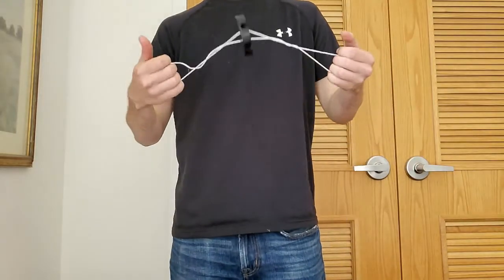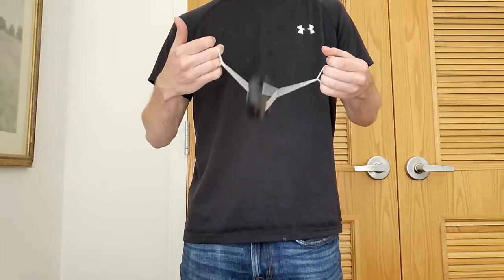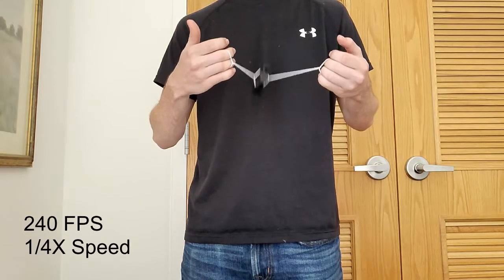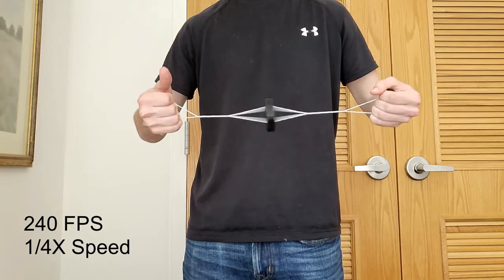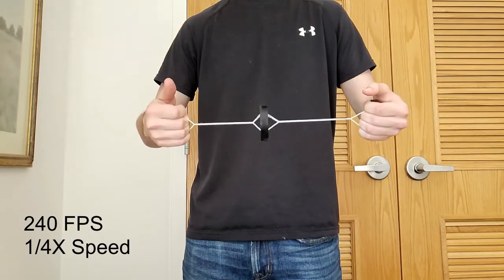Next, I wanted to document actual operation of the device to help anyone else using this in the future. I also took some slow motion videos just for fun, but using the slow motion footage, I was able to back-calculate and find that the device was going about 3600 RPM.